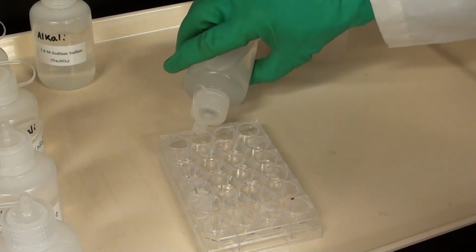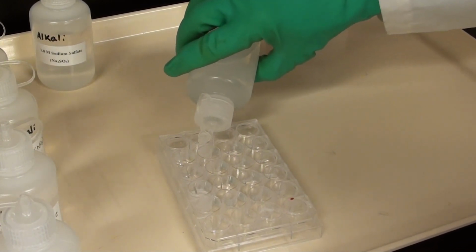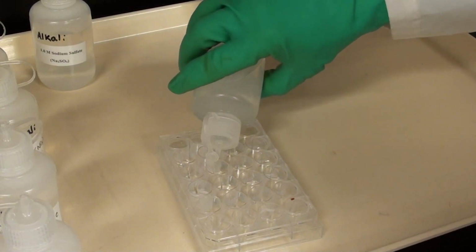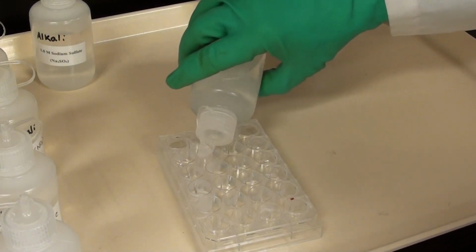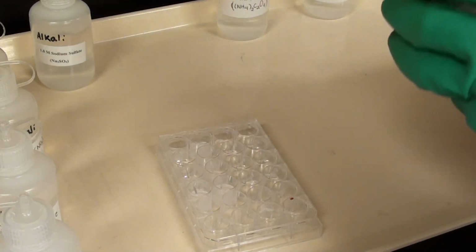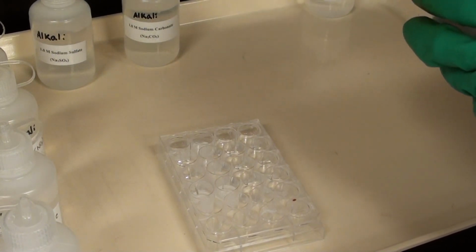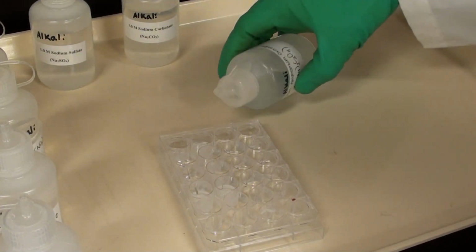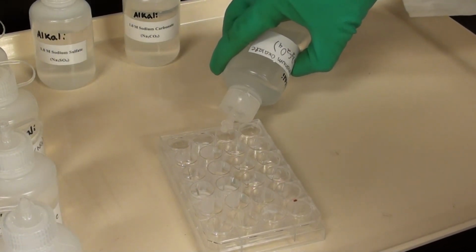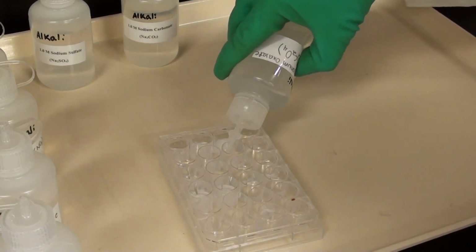Then I'm going to show you the end result of each one. And it's okay if these are a little different. Do not expect all of them to be exactly the same. Some of them are going to produce precipitate, some won't. Some are going to produce a very thick precipitate, and some are going to produce a precipitate that's very fine, or even possibly hardly visible.